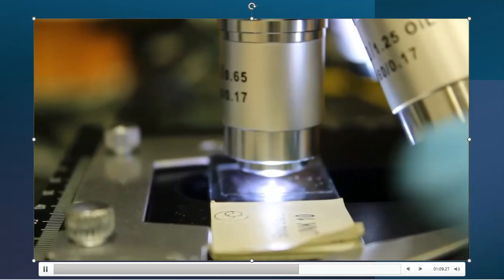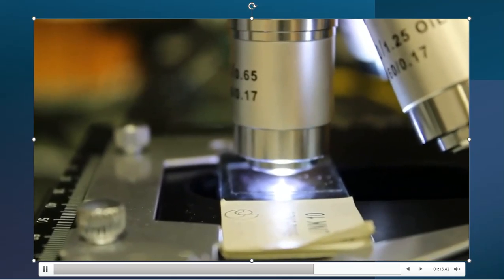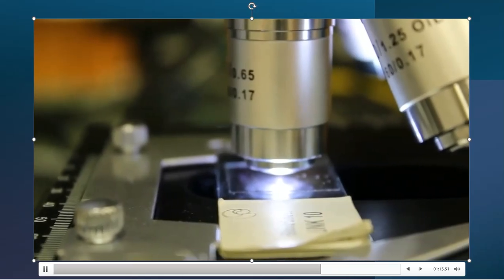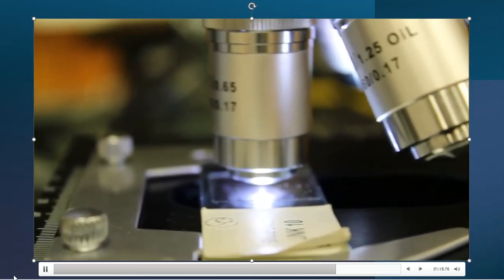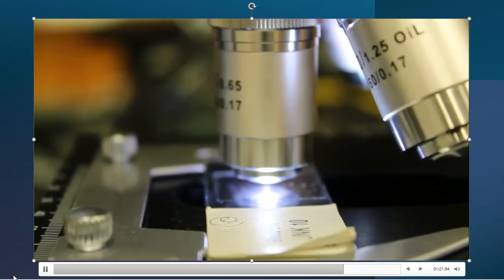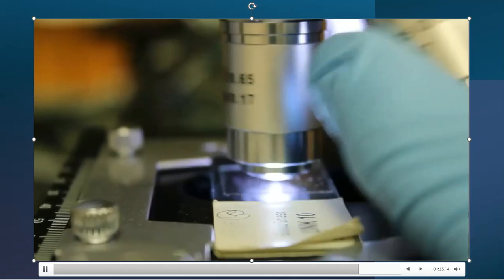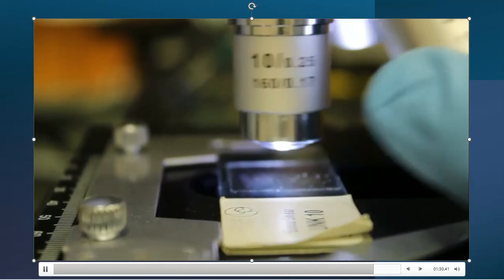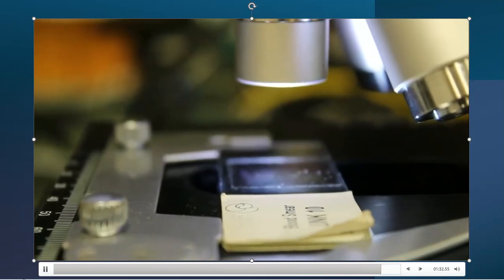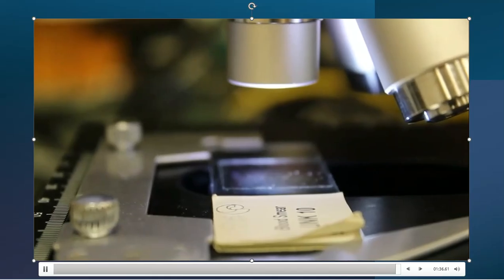If you need to lower this platform down a little bit more, please do so. It's always going to be safer than sorry later, because we don't want you to damage your microscope slides, and that's the thing that you're going to do if you're not very careful. All right, so that's, again, the rule of thumb when it concerns the 40. Please keep that in mind as you begin to analyze these blood samples and these microscope slides. Again, major differences between the length of those lenses.